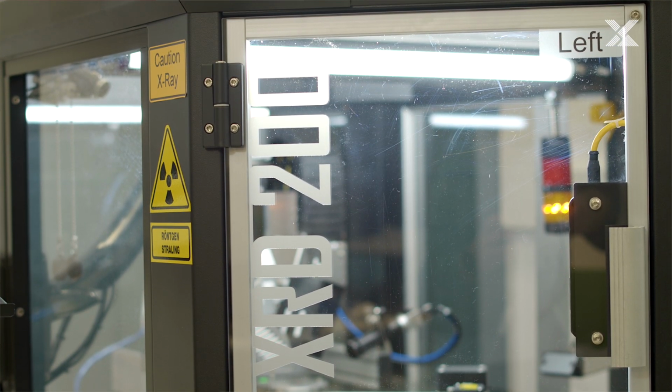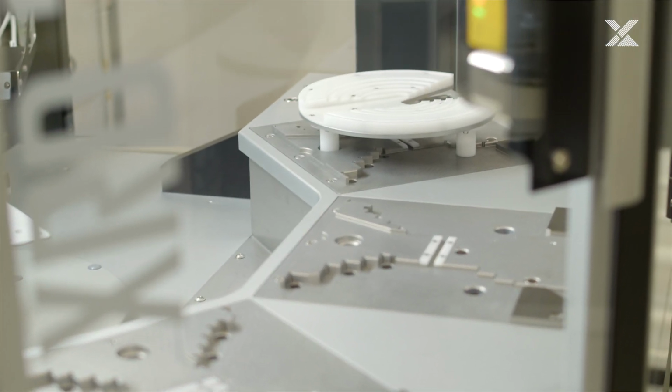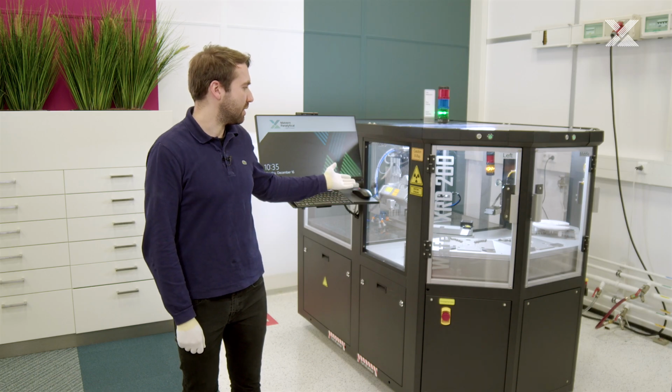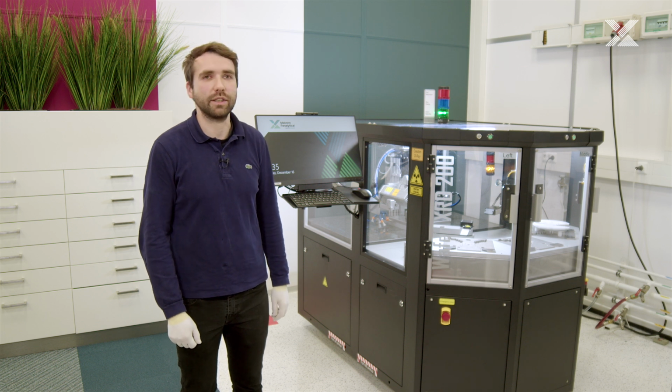So let's have a look at the Wafer XRD 200 components. First of all, we can see three different stages for wafer cassettes; the instrument can contain from 3 to 5 wafer cassette stages. In the center of the instrument, we can see the handling robot moving the wafers from the cassette to the measurement table. It has two different paddles, or end effectors if you wish. In this case, the wafers can be measured in an alternating manner, which speeds up the measurement process.